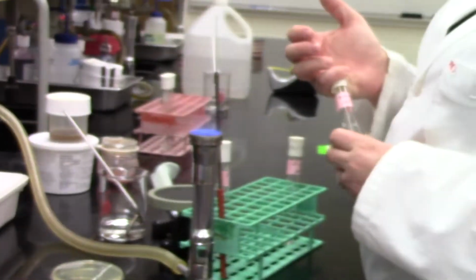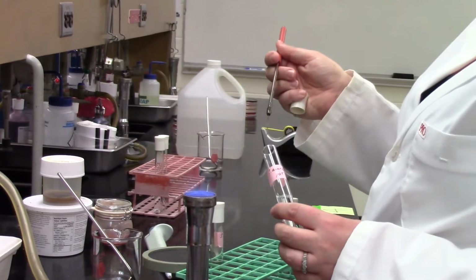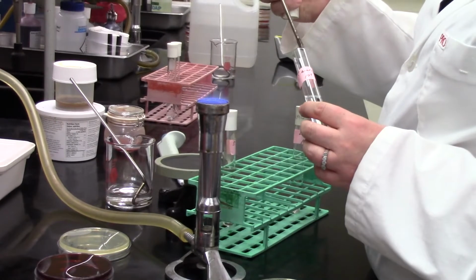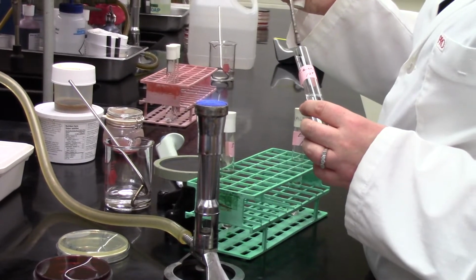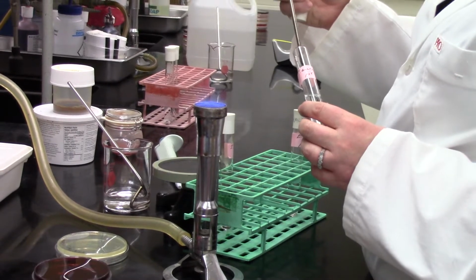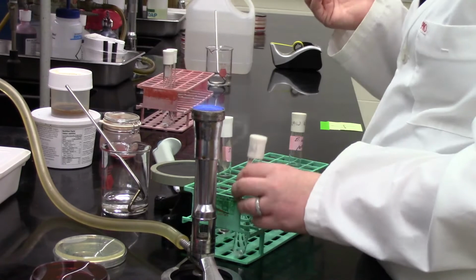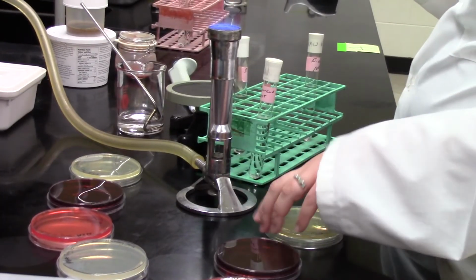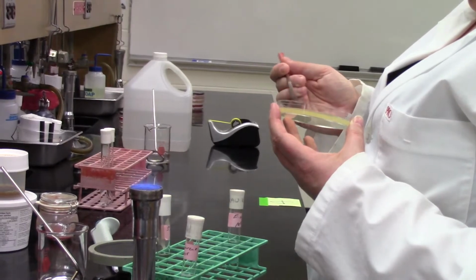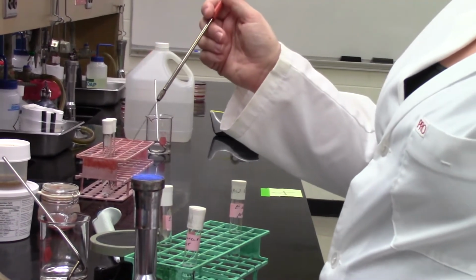Same pattern, always mix before so that we know that we have those bacteria nicely resuspended in that culture. One of the things that can happen is, they are essentially cells floating around in a liquid. They will eventually settle to the bottom of that tube. And if they've all settled to the bottom of that tube, you can get the impression that there's very few bacteria in that test tube, unless you actually do that good vortex before you get started.